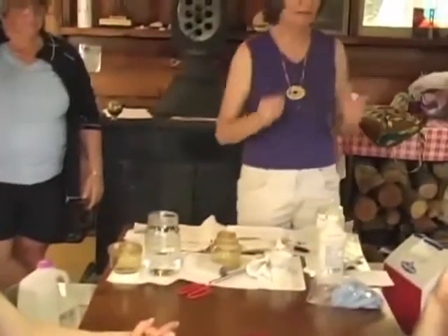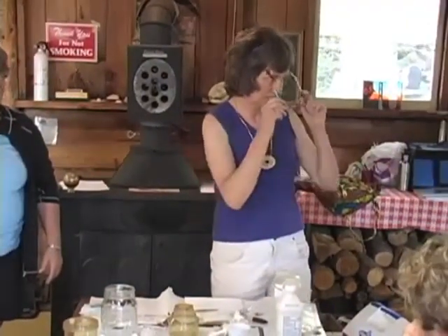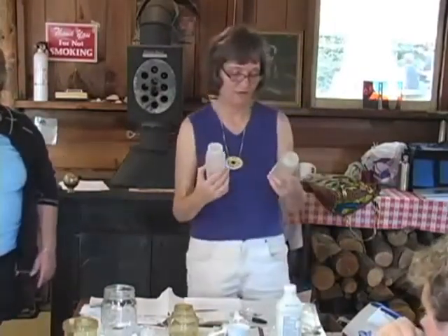Next one. Okay, now we're gonna start the process again. I'm gonna let other people do steps this time, and so it can be probably optional from this point on. Do we have to move on to do something else? We will have other things to do, but let's at least run through a couple of them first. Okay, yeah, so let's vote.